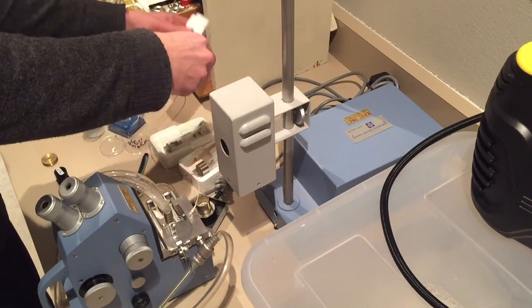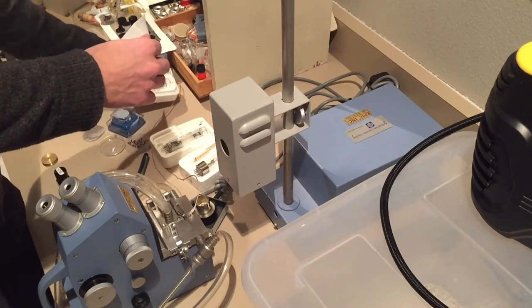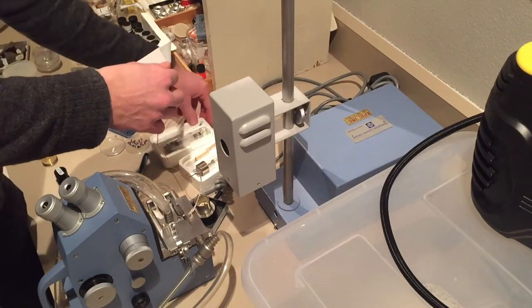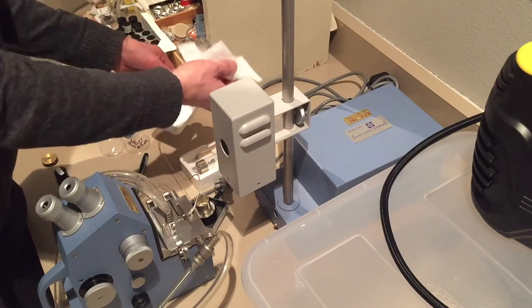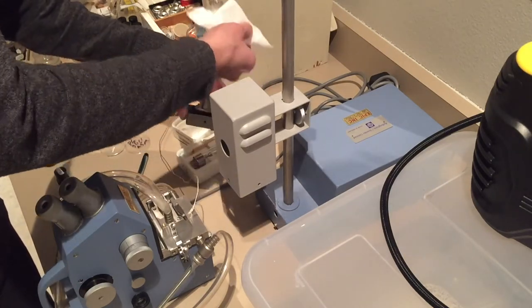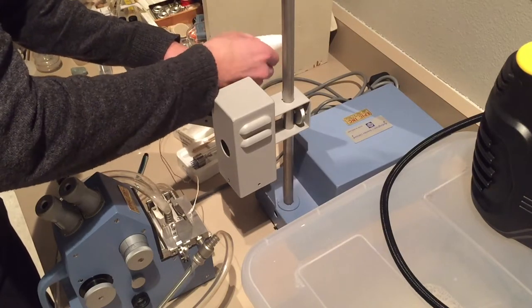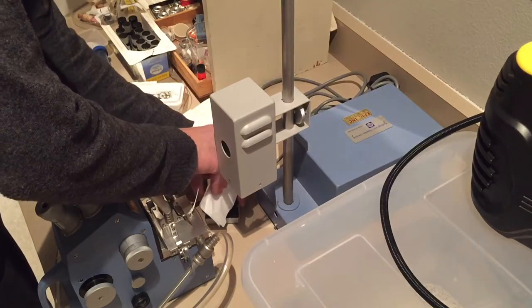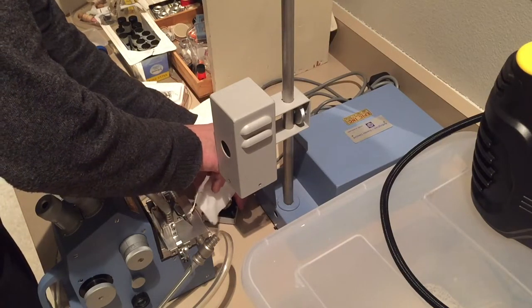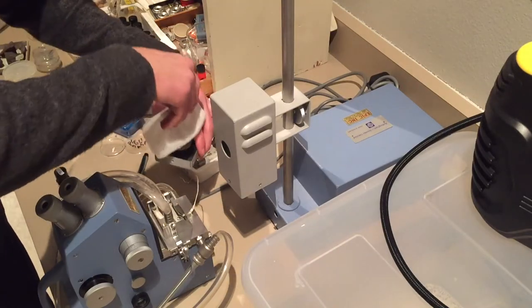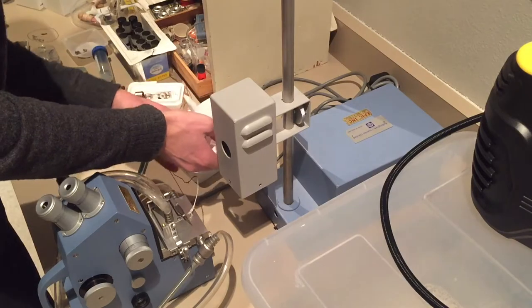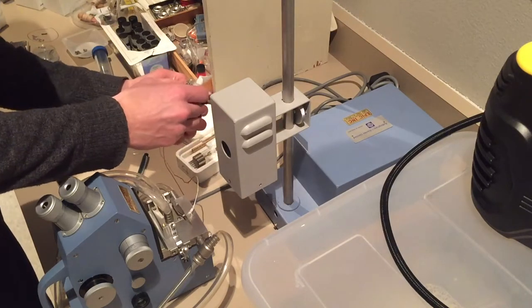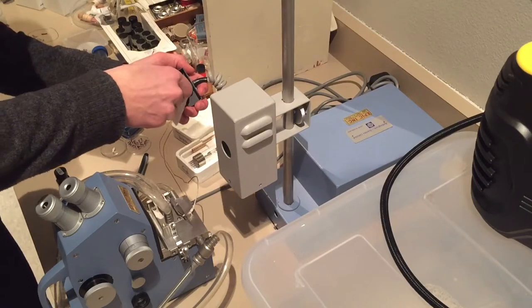What I have here is a critical angle refractometer equipped with gas discharge bulbs. This allows me to measure refractive indices at multiple wavelengths of light, because refractive index varies with temperature and wavelength of the incoming light. We want to be able to control those two things, or at least know what they are when measuring the refractive index of the oil.